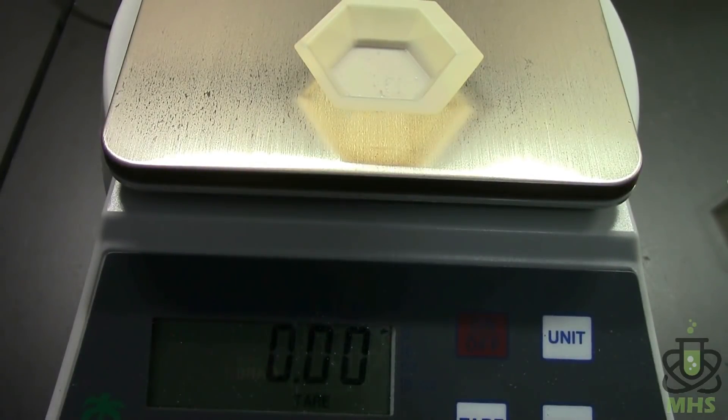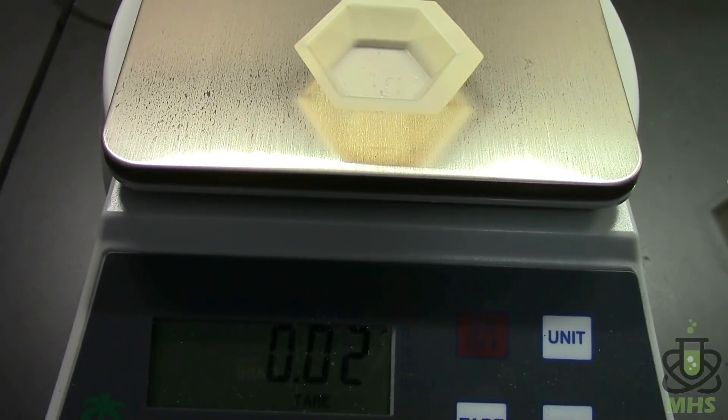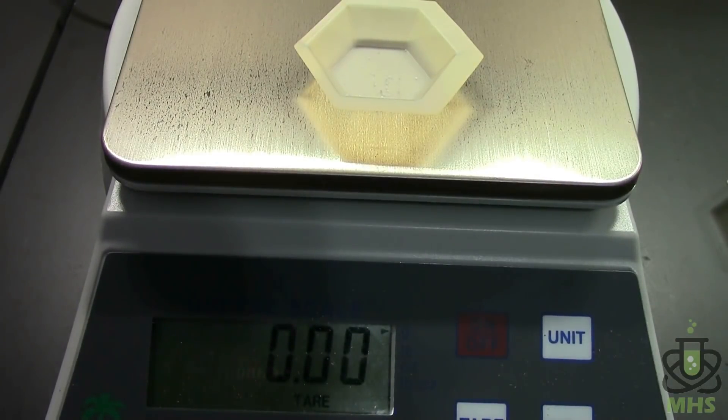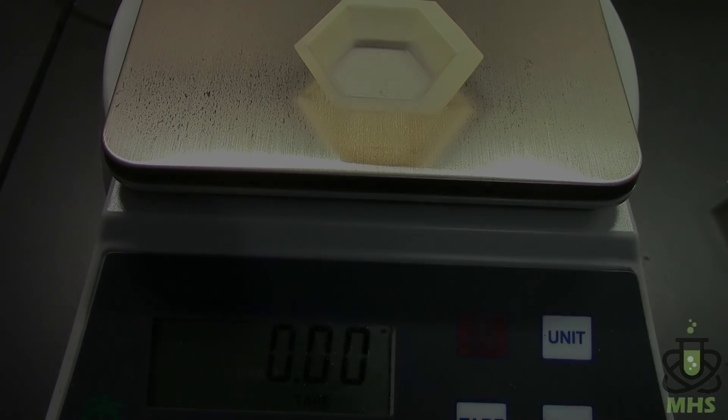Sometimes if you poke at it a little bit it can settle back on the actual weight. I think it's too small for this scale to measure.